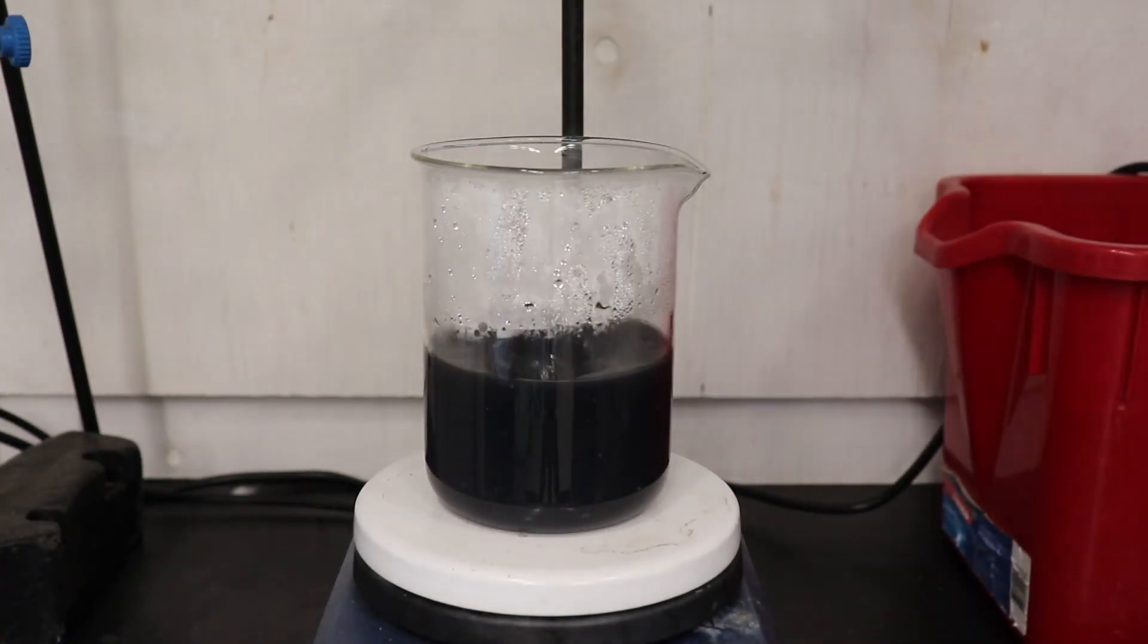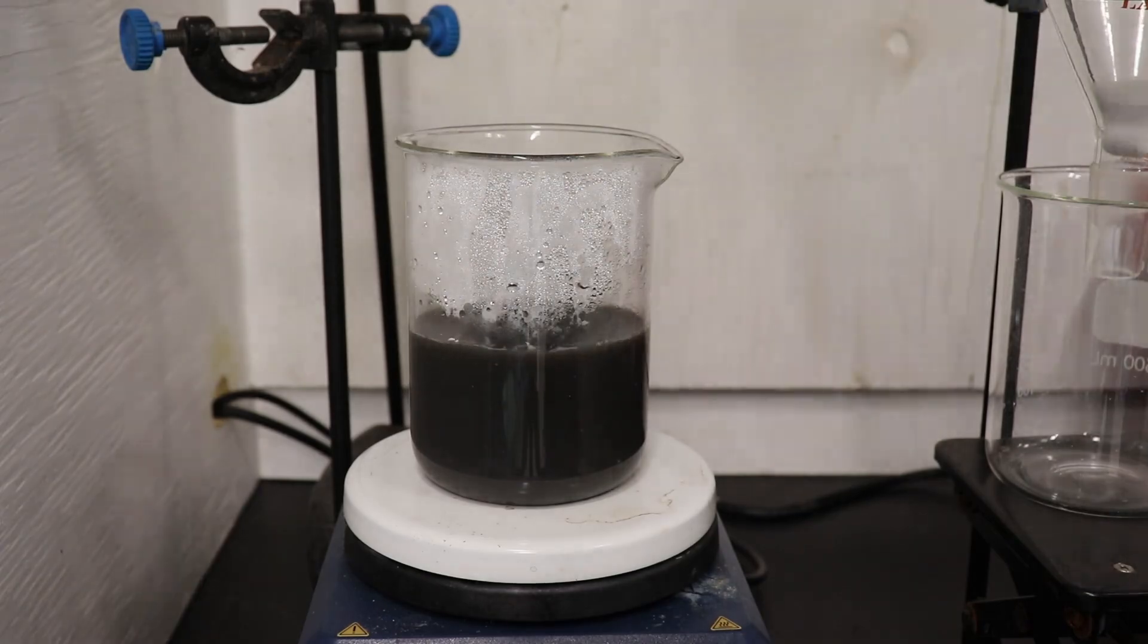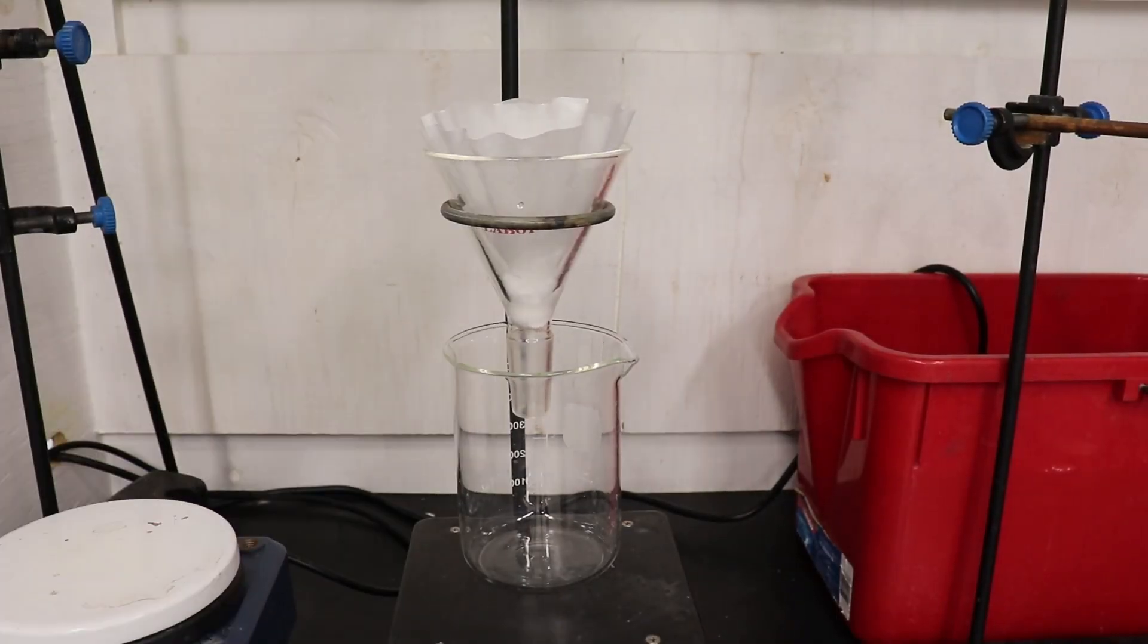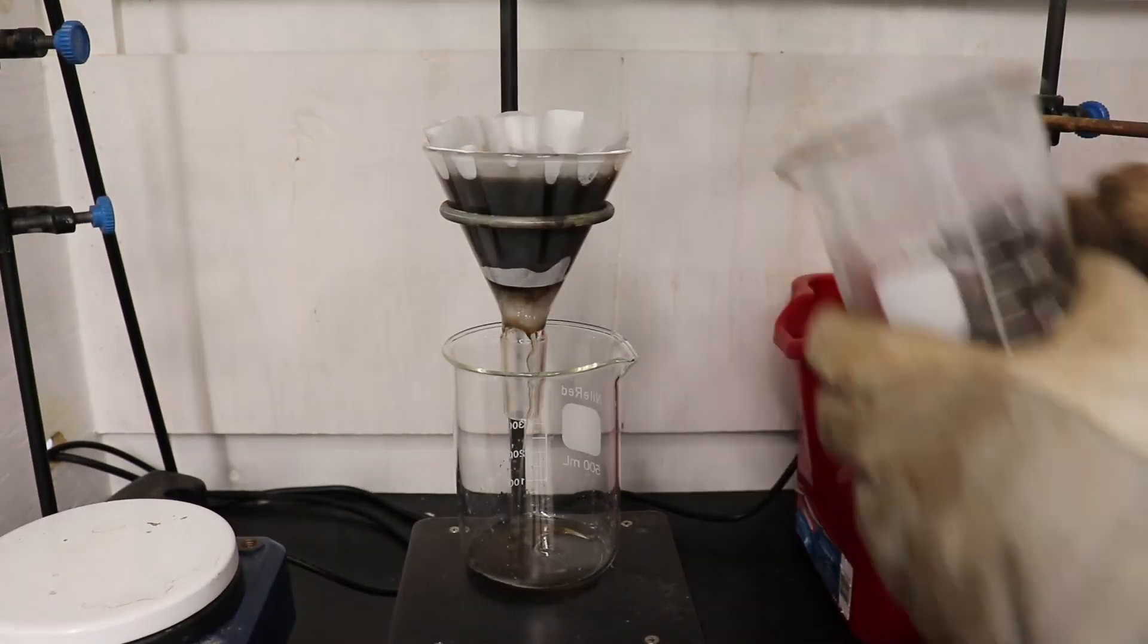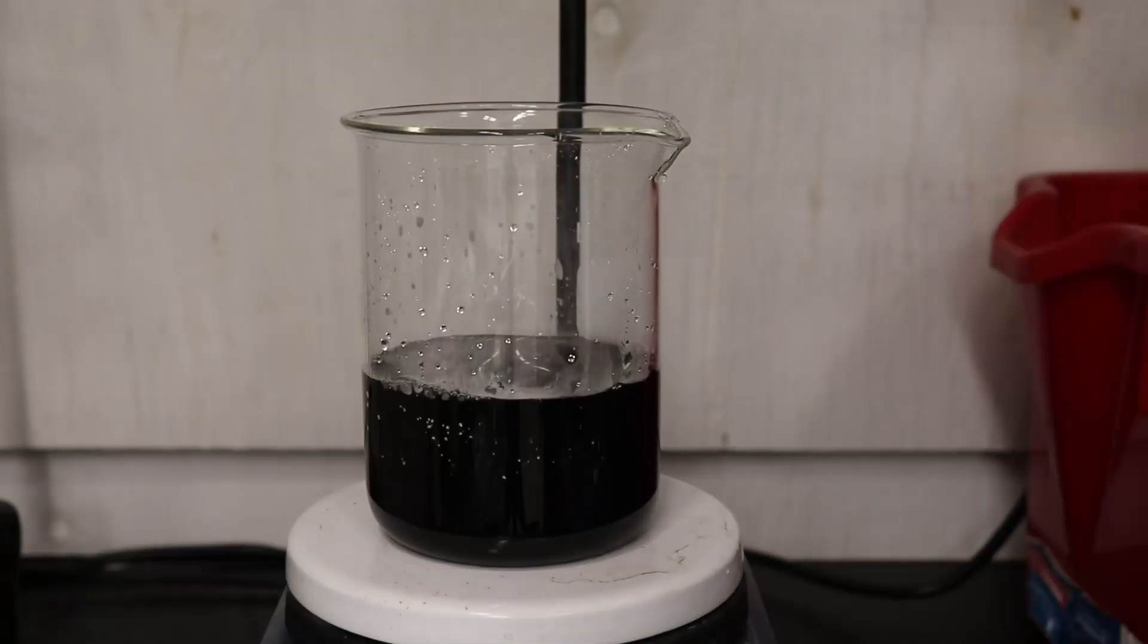I tried decolorizing the solution at this step using activated charcoal, however it didn't seem to have any effect. I also added a bit of celite to try and capture any small particulates, and then filtered the solution.